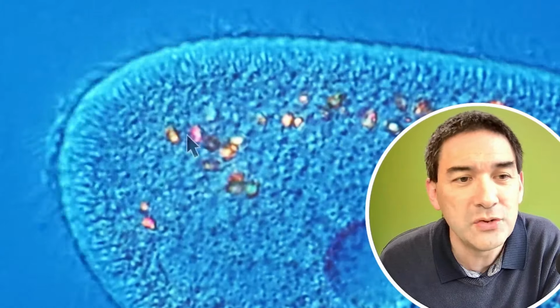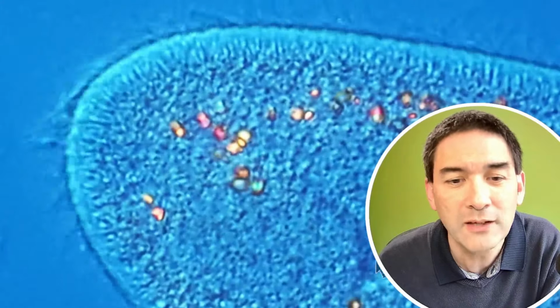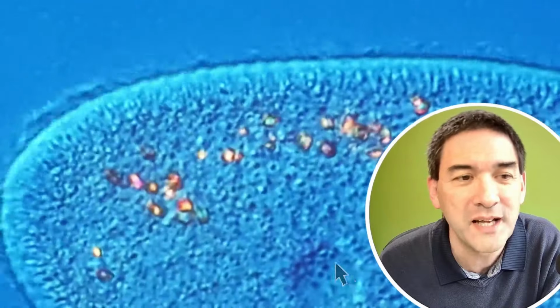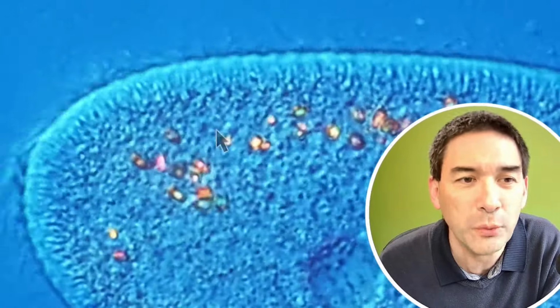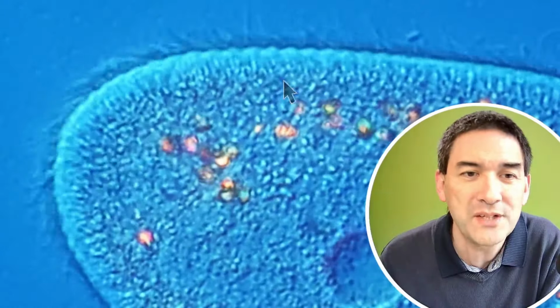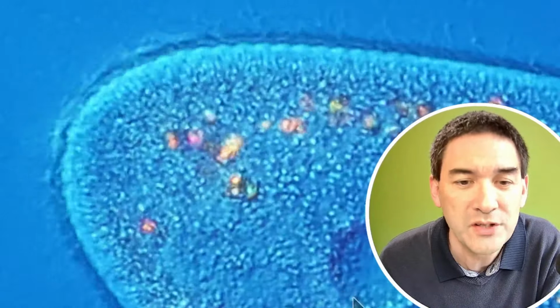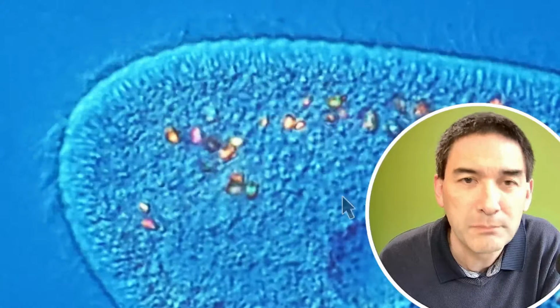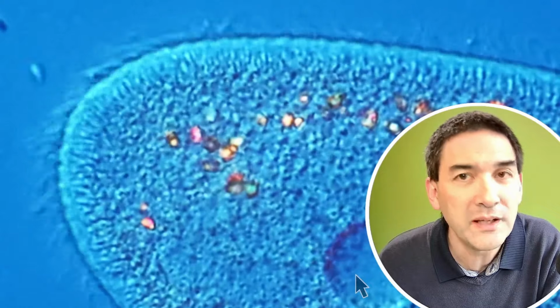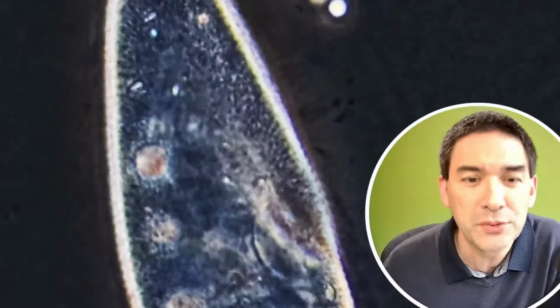And those things that you see inside the cell here, these are food vacuoles and so on. And the contractile vacuole, see, it's a little bit covered up here, and it's on the side. And by osmosis, there's always water flowing into the cell. The cell, of course, is expanding, but the cell membrane on the outside is not strong enough to hold the cell together, and for this reason, you've got this contractile vacuole over here that pumps the water out again. I would now like to show you the video that I made with phase contrast, because even though it looks a little bit blurry, you can see the procedure much better.